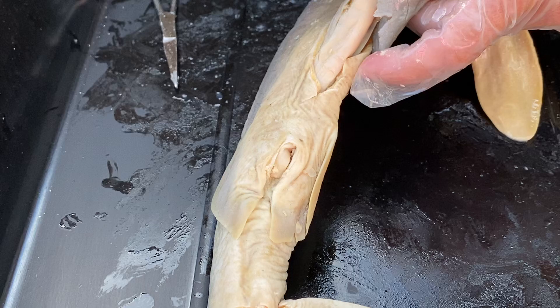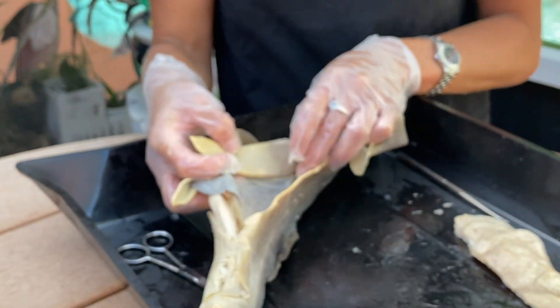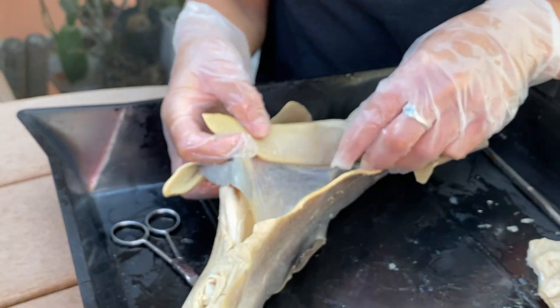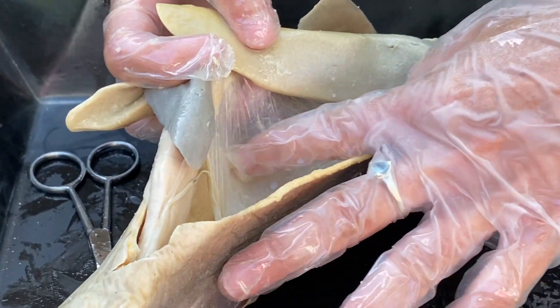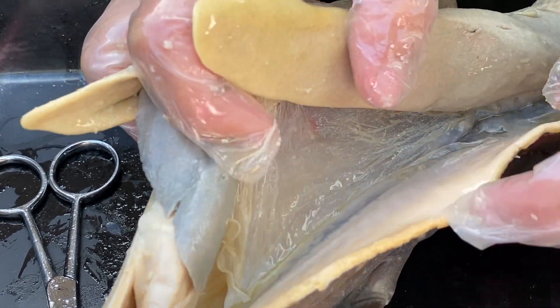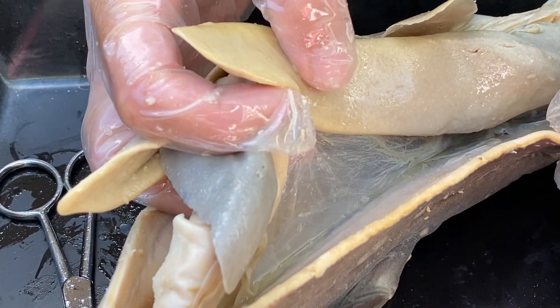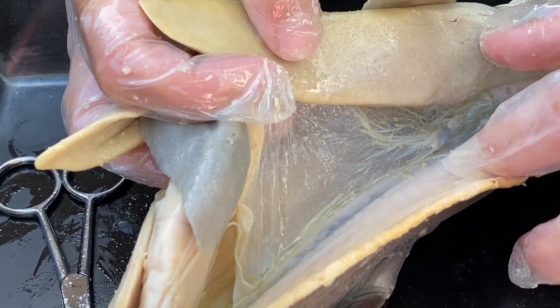If you notice, it's kind of everything that's fit into this shark. This shark is literally an eating machine — it's just eating and swimming. But it has this really thin fibrous material that is called mesentery. This is what's allowing the organs — and we have this too — to kind of move around a little bit, still have their area, but gives them a little bit of flexibility.